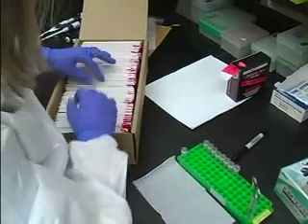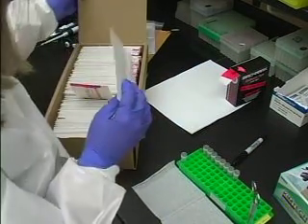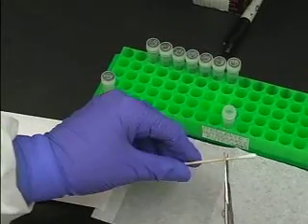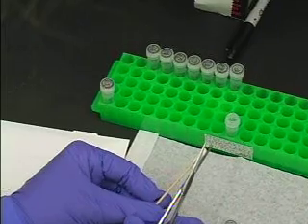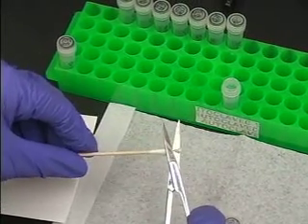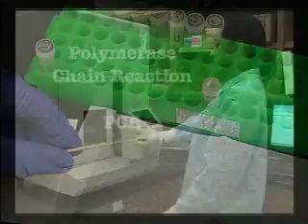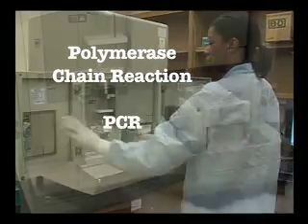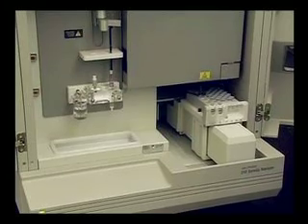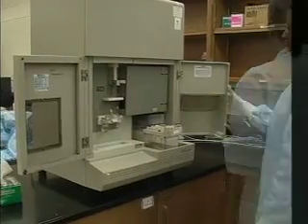on the items. Some items are DNA tested that do not undergo serology testing, such as hair roots or ball caps. The testing involves cutting a portion of the evidence, extracting or removing the DNA from the item. Then a test is run to determine how much DNA is present. Next, polymerase chain reaction, or PCR, is used to copy the specific DNA regions that are to be examined. The DNA is then typed on a genetic analyzer.